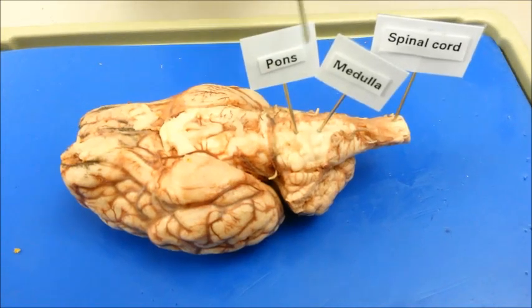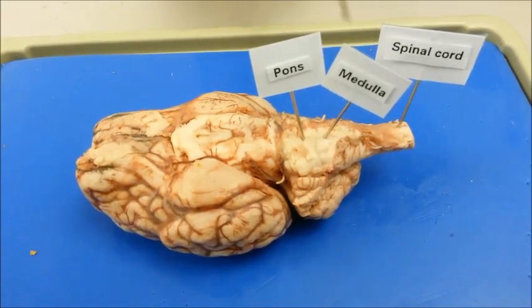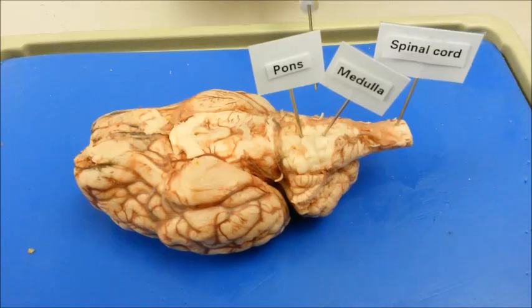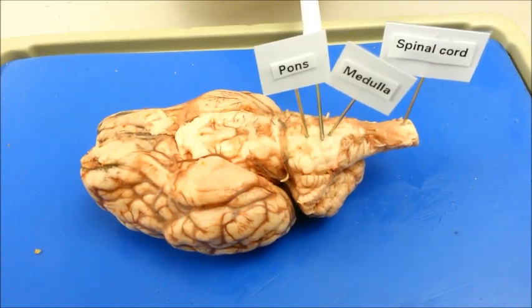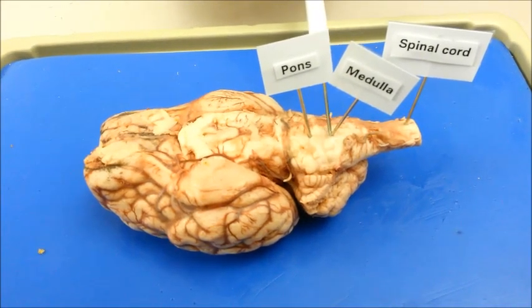Here is the brainstem, which is made up of the medulla, pons, and the midbrain. It helps to connect the cerebrum to the spinal cord and serves as a passageway for neural signals to be relayed.